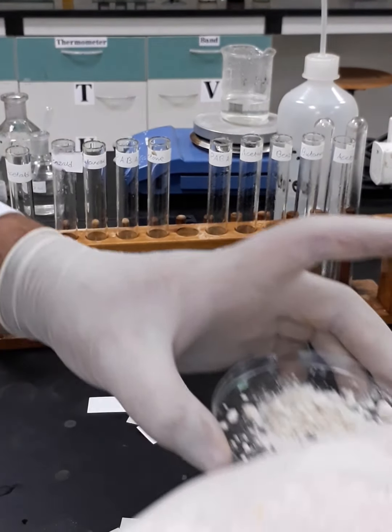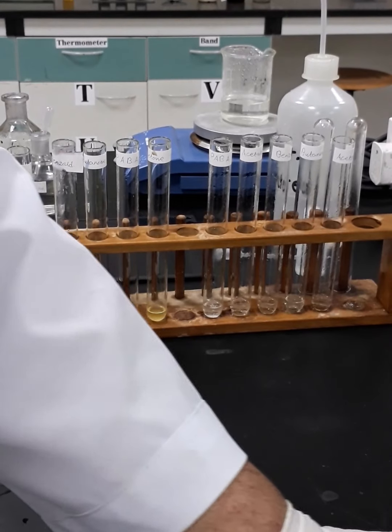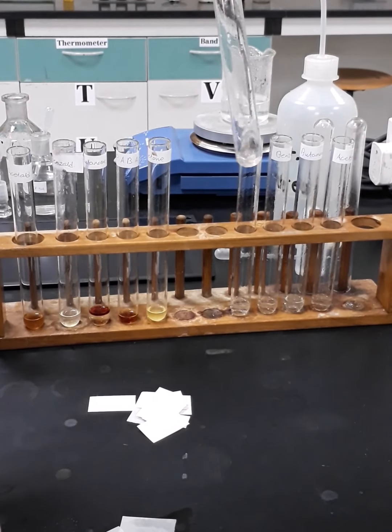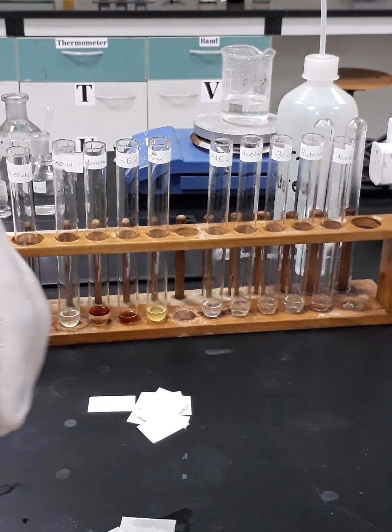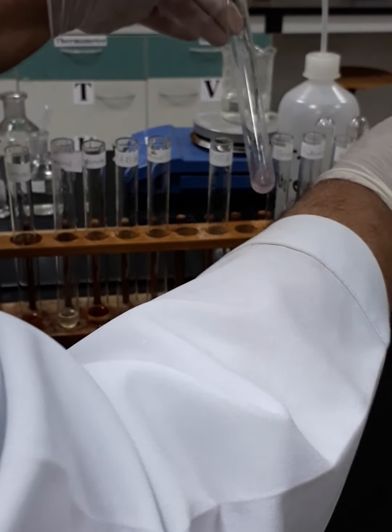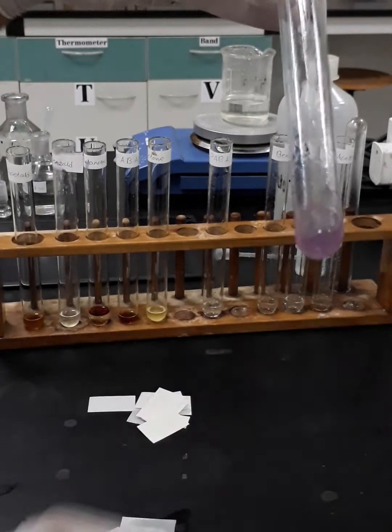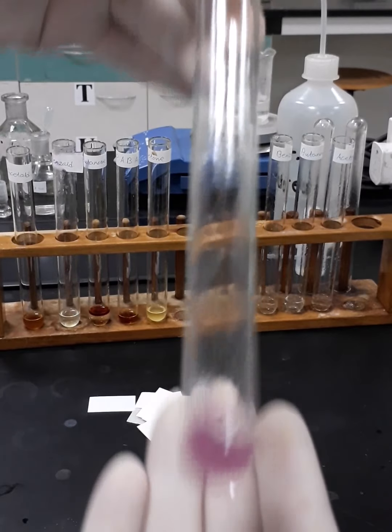I will start by para-aminobenzoic acid. Let's see if there is any pinkish color change. No. Okay, so now let's go with the acetaldehyde. We'll add just a few drops. Then we will shake it. Yes, we have pinkish discoloration, if you can see the color.